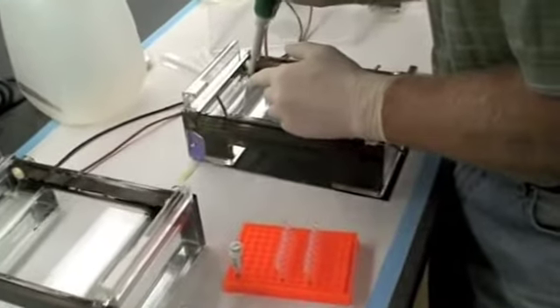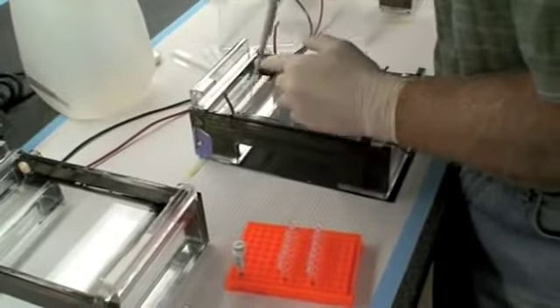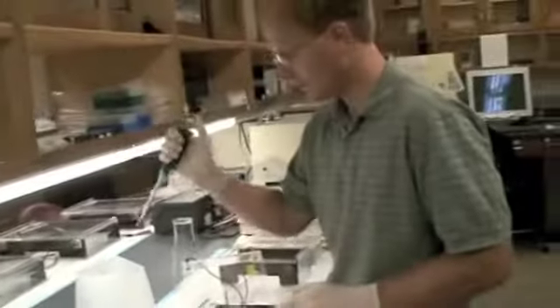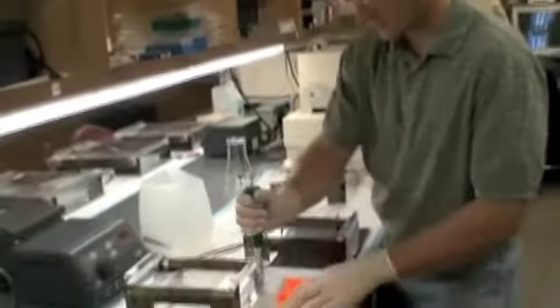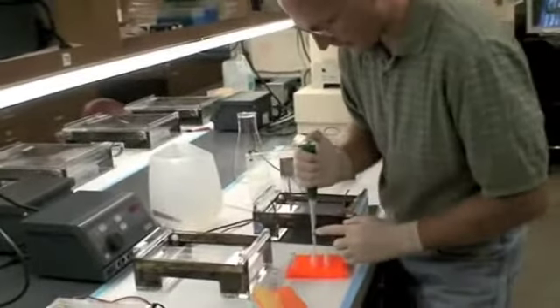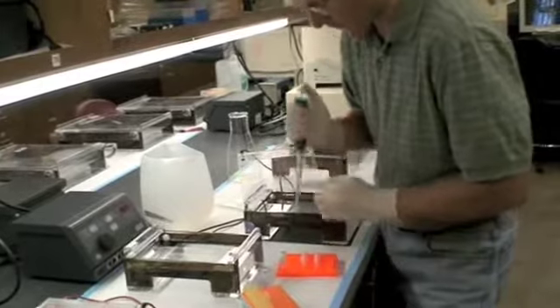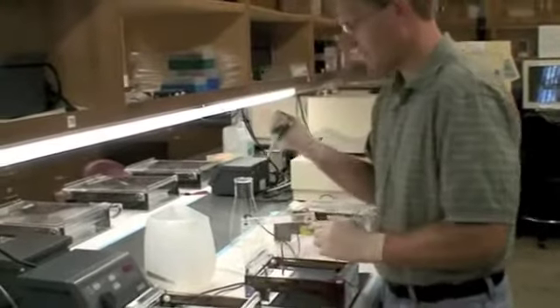Again, I'm resting my hand on the gel box. Particularly on these side ones, it's easy to do. Now, I don't go to the second stop of the pipetter. That'll blow a bubble in there and actually some will come out.